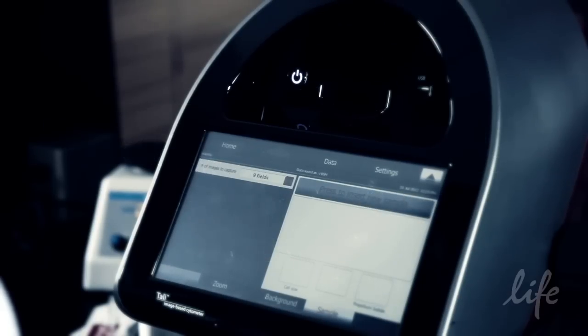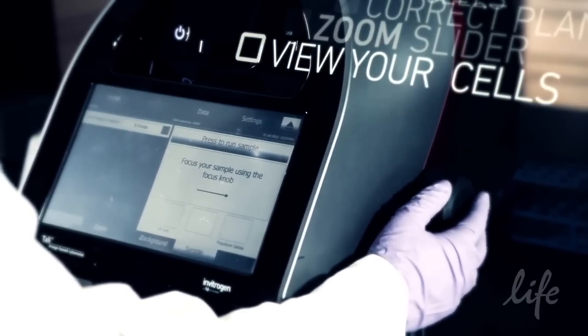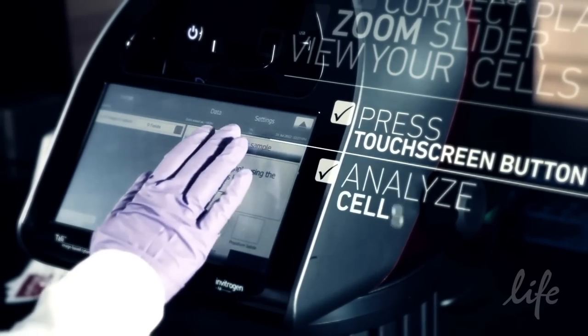Focus your cells to bring them into the correct plane of view. Use the zoom slider to give the best view. Touch the press to run sample button to analyze your cells.